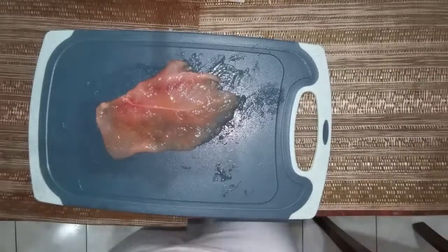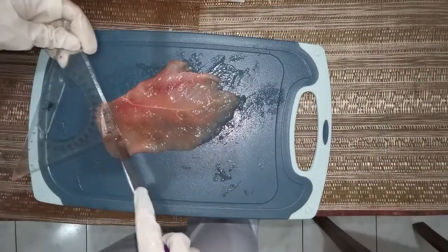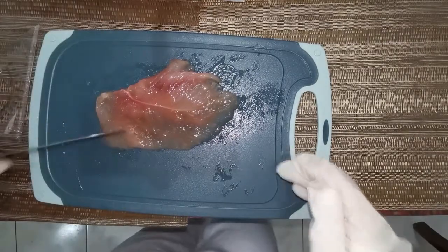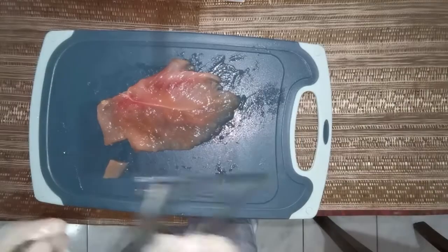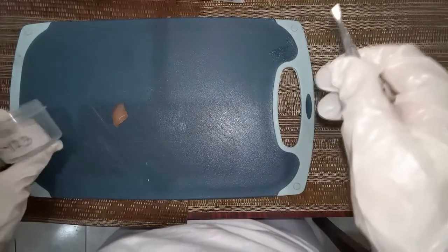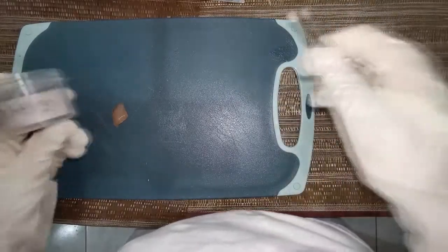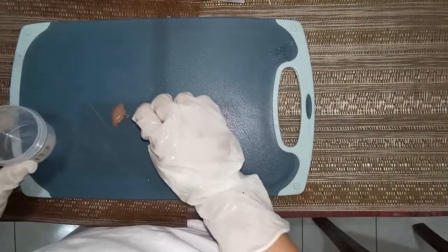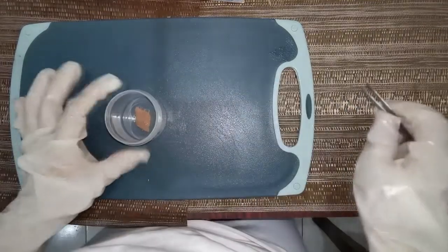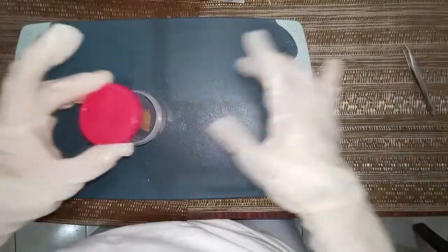And now we are going to cut a representative specimen into 2 cm squared but not more than 4 mm in thickness. And that is in order for the fixative to penetrate the sample thoroughly. Fixation is the preservation of biological tissues from decay due to autolysis or putrefaction. It terminates any ongoing biochemical reactions and may also increase the treated tissue's mechanical strength and stability.